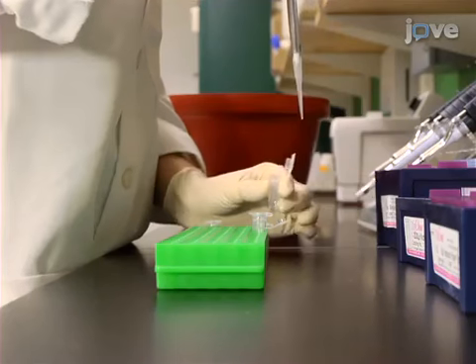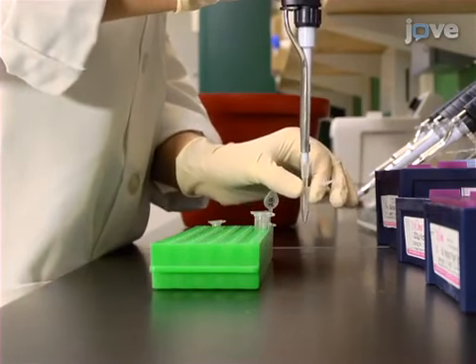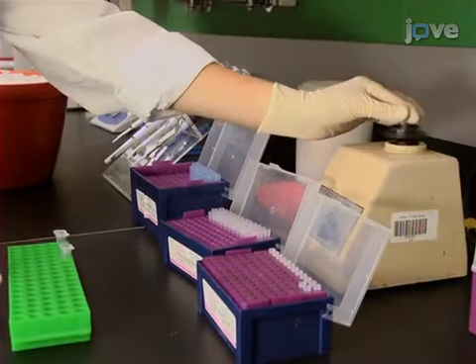Also, prepare the streptavidin buffer by mixing 57 microliters of assay buffer with 3 microliters of sterile filtered streptavidin at 10 mg per milliliter in assay buffer.